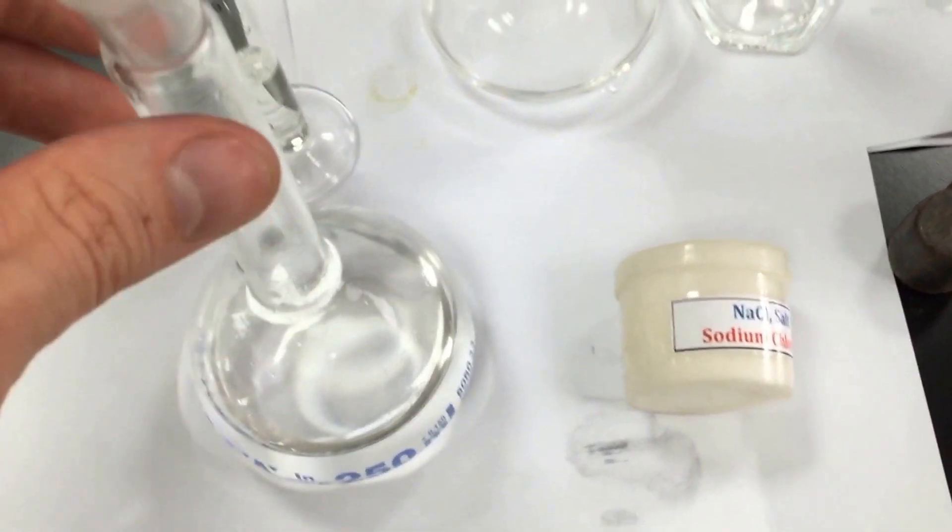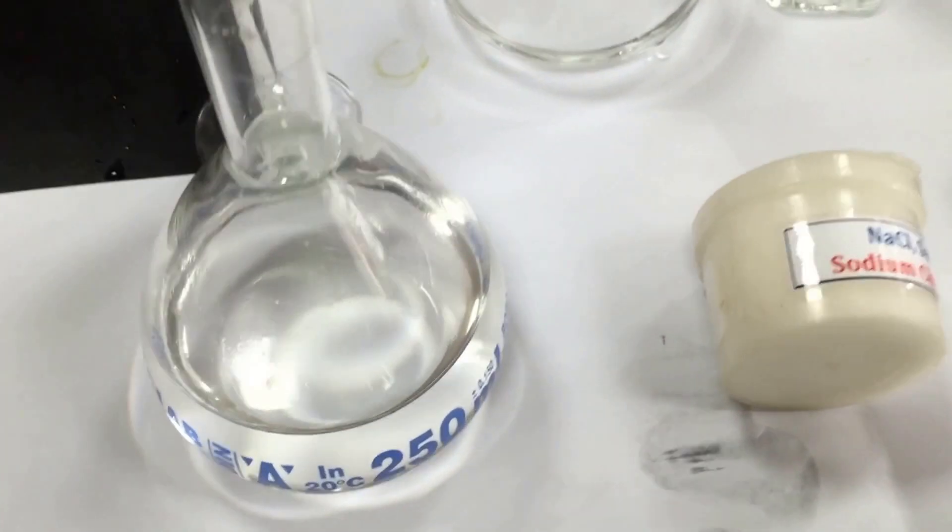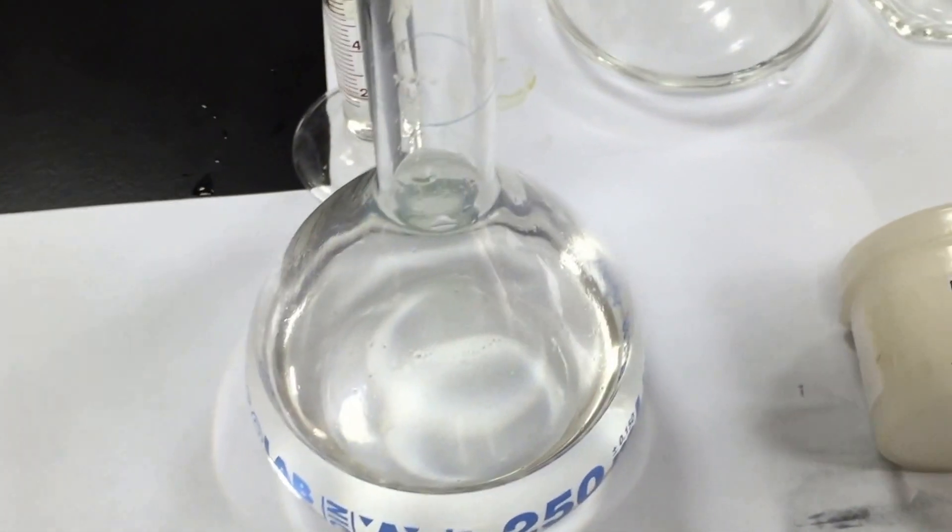49.726 grams to be precise, and I made it up to 250 milliliters in this volumetric flask.